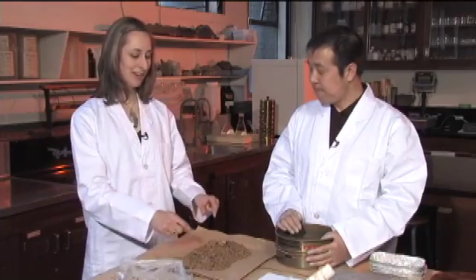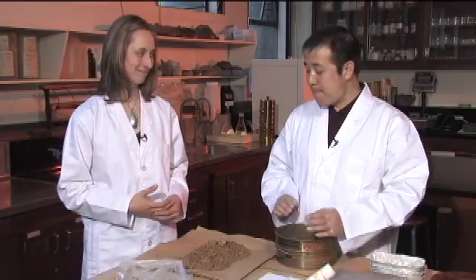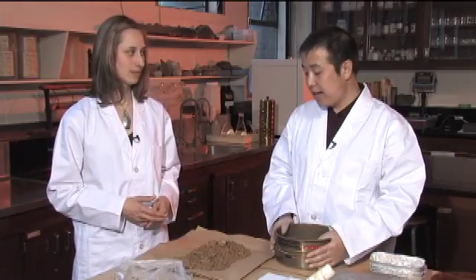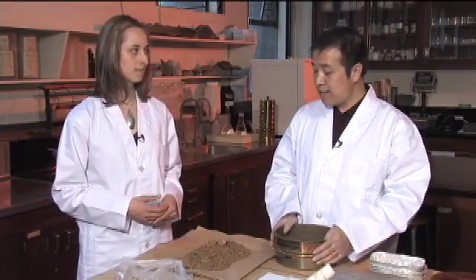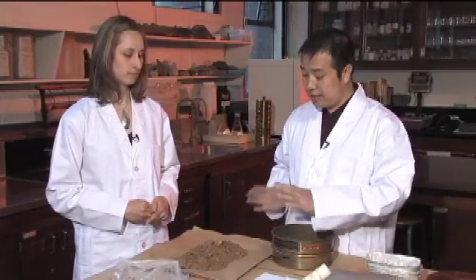We don't need all these big things — how are we going to get rid of them? If your sample is dry, every particle will fall apart easily and you can just sieve straight away. If the soil is wet, it's better to let it air dry for several hours first, and when it's dry you can do the separation.